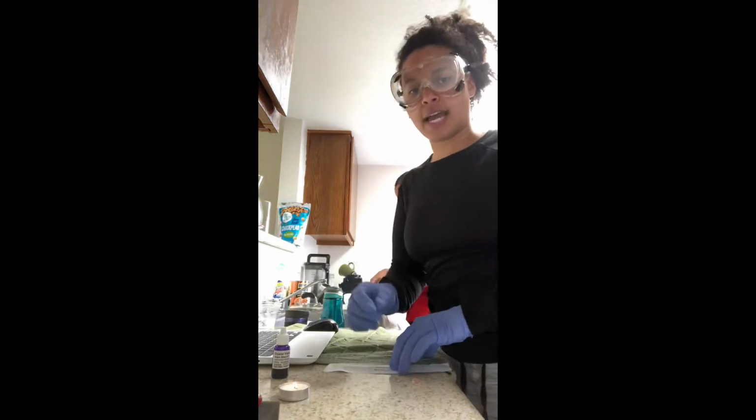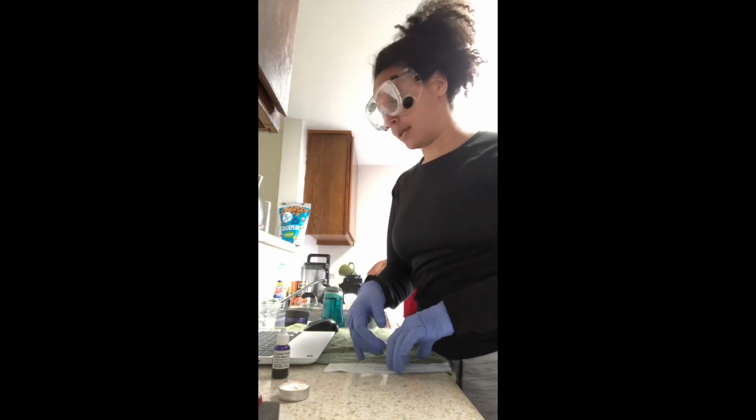This exercise is going to be the first of direct and negative stains. In this exercise, I will be using simple stain techniques with direct and negative stain to prepare smears. I will identify basic morphology and bacterial shapes and arrangement.